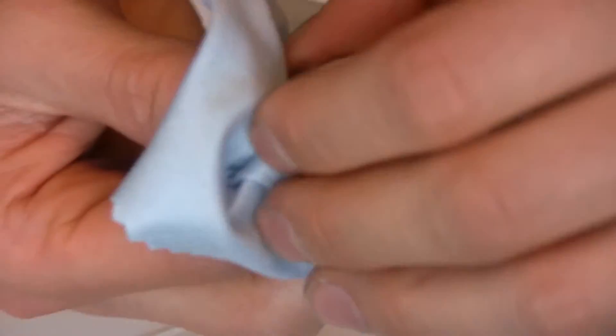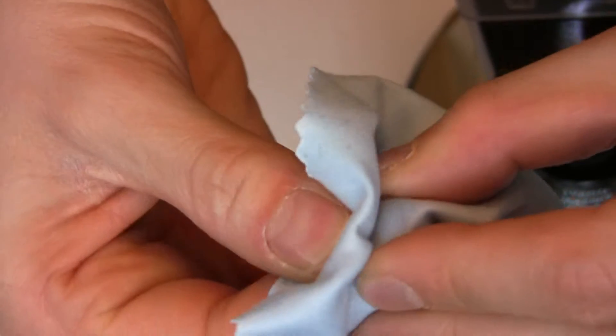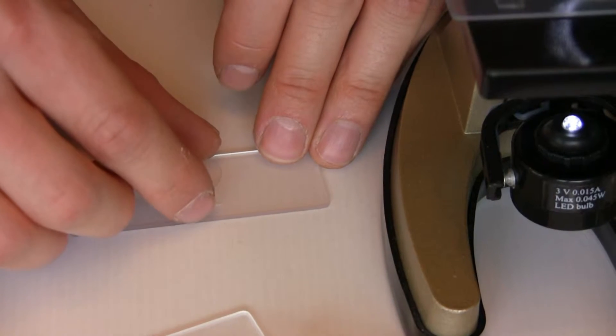Then I take a cover slip, a clean cover slip. I'm just making sure I get rid of all fingerprints and bits of dust off the cover slip before I put them on, because otherwise that might block out what we actually want to see. Marvelous.